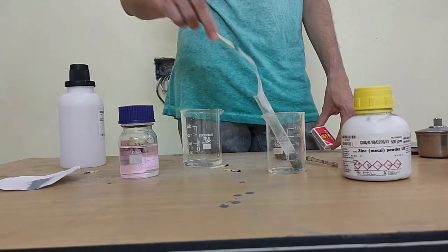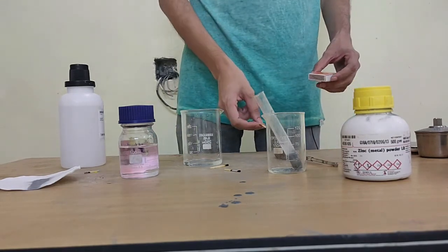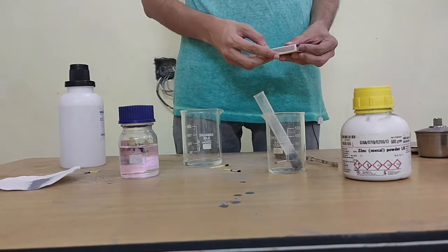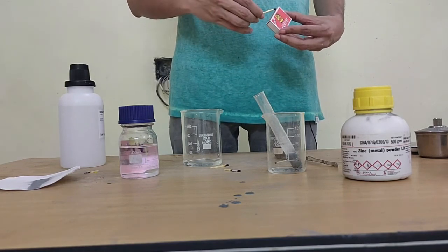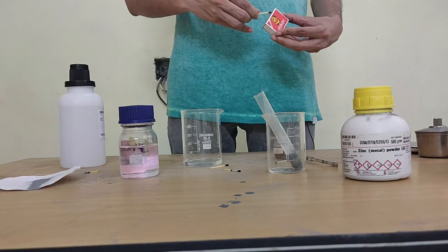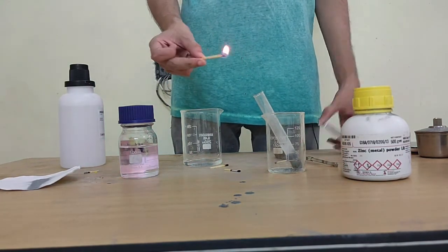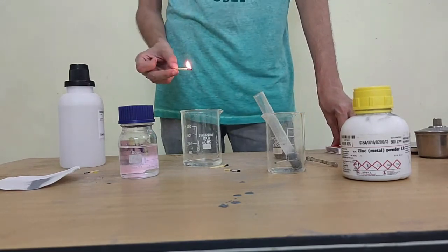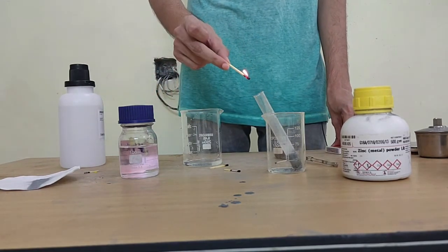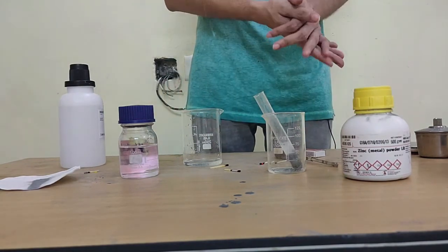Trying to see if it happens. Oh, there, see? Interesting. And no matter how many times I keep doing it, it will keep happening, and you shouldn't overdo it or the apparatus will heat up and probably explode. Right, so this is today's reaction, metals and acids to give the respective salt and hydrogen gas. Okay, so that's all for today. Thank you.